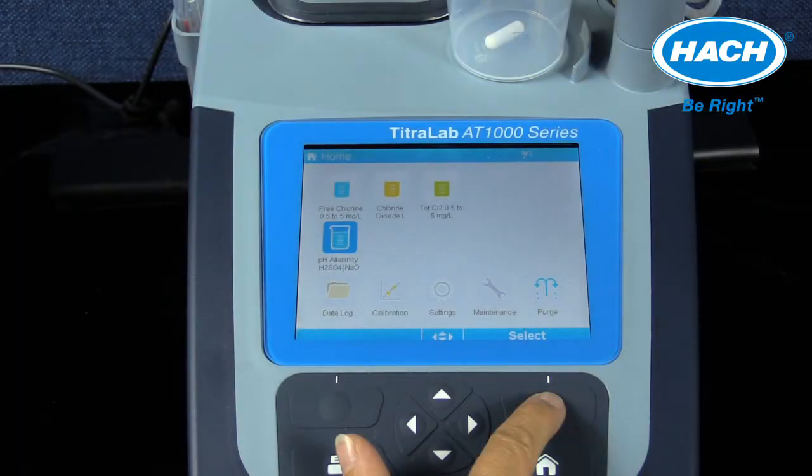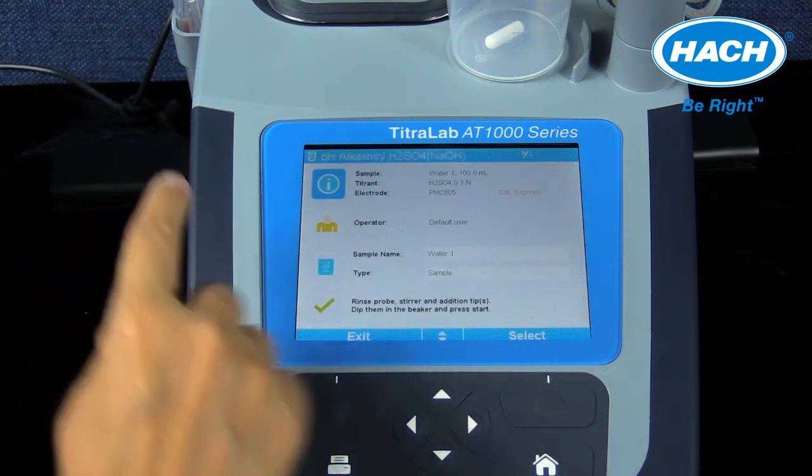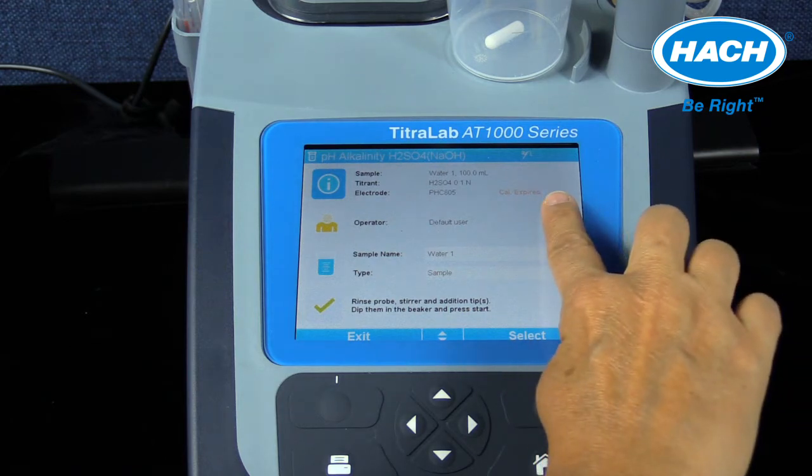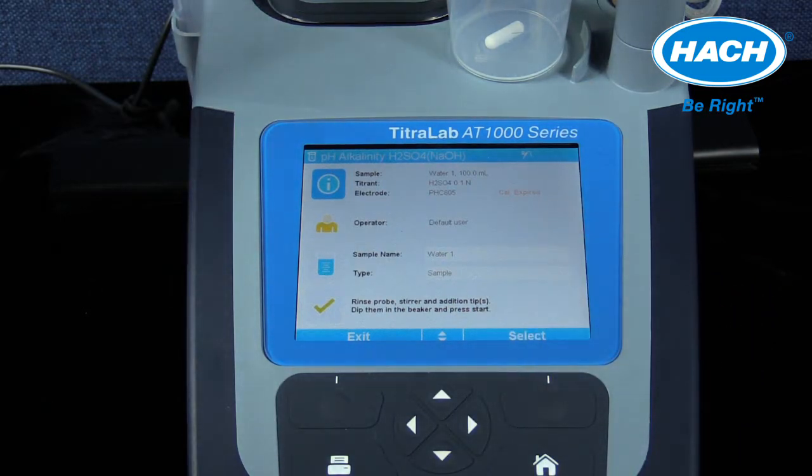There are several application notes that include a recommendation to calibrate the electrode. The pH alkalinity application AP0001.AT1102 is a good example. In this training example, the AT1222 model is used. In the loaded pH alkalinity H2SO4 method screen, the software has alerted the user in red text that the PHC805 electrode is using an expired calibration. The software is utilizing a pre-programmed calibration setting to generate this message.